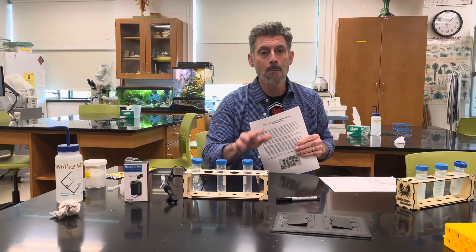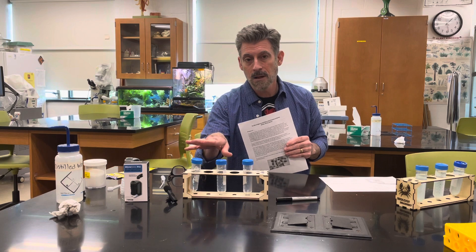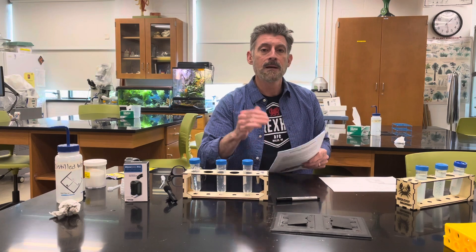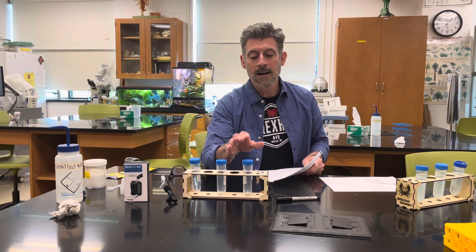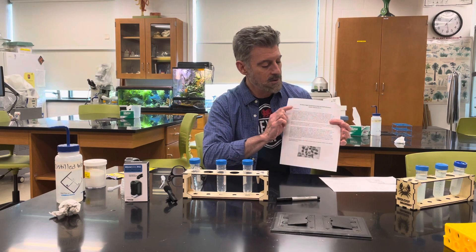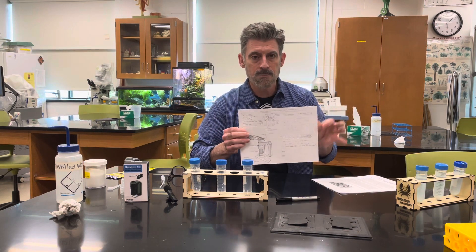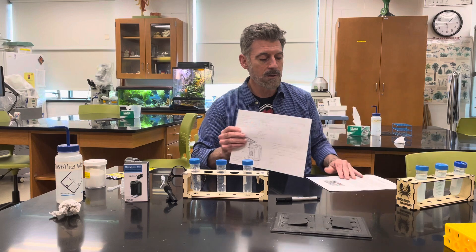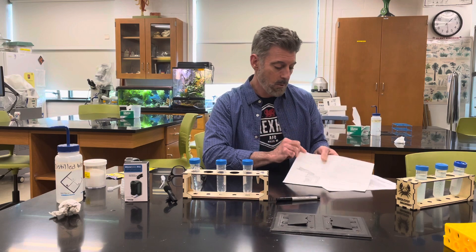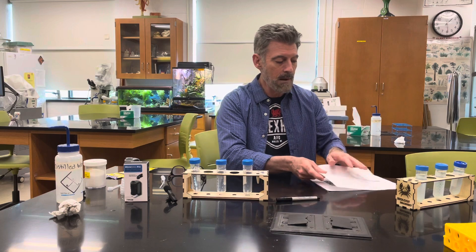There are slightly different versions of these instructions for different courses. The non-majors course is running this but not doing as many treatments — you're just going to have a no-sugar and a sugar treatment. Biology majors will have no sugar and then two different concentrations of sugar. Just pay attention to your very specific instructions for your course. You'll also have a quick guide provided — all these things will be in Blackboard — and it will tell you what equipment you need and give you a visual reference.